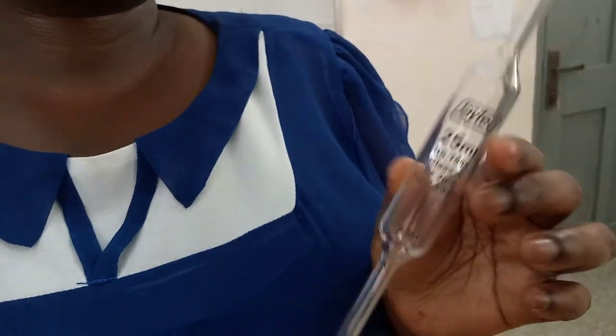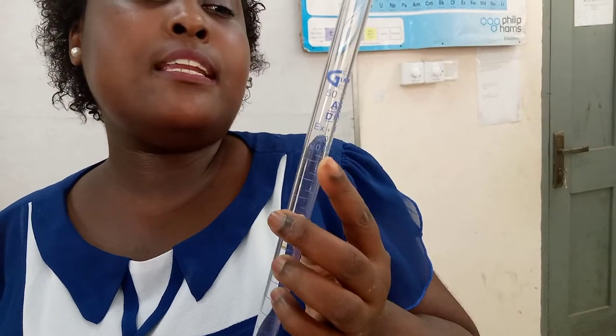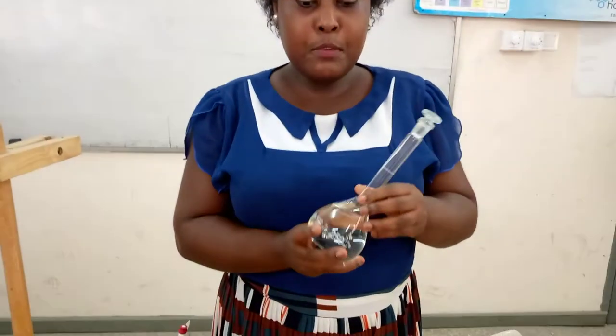But if the glassware you are using is not calibrated by the manufacturer, you need to calibrate them. Liquids are calibrated at 20 degrees Celsius. I have here with me pipettes and burettes. When you look at the pipette, the expanding region of the pipette, you will see the temperature written on it — 20 degrees Celsius — which means that this pipette was calibrated at 20 degrees Celsius. It applies for the burettes as well. The burette too has it written here: 20 degrees Celsius. And you can see the error margin on it — it is plus or minus 0.05. There is an error margin on the pipette as well. I also have here a measuring cylinder, also calibrated at 20 degrees Celsius, and the error margin is there as well. It applies to the volumetric flask too.